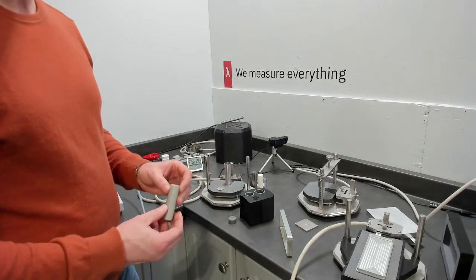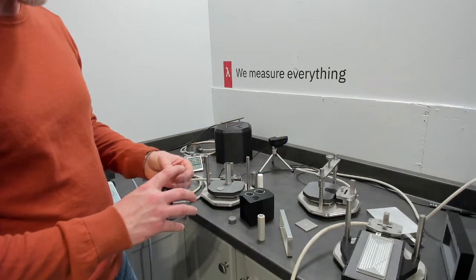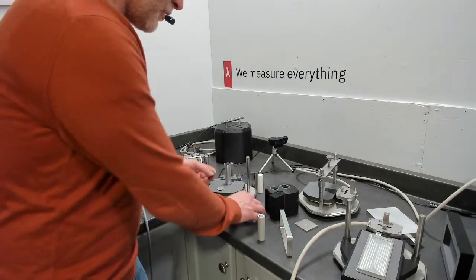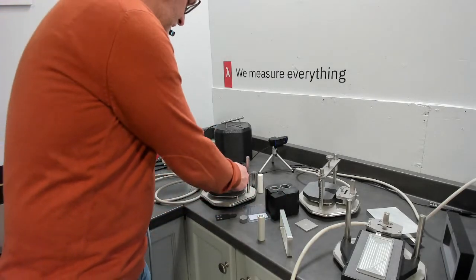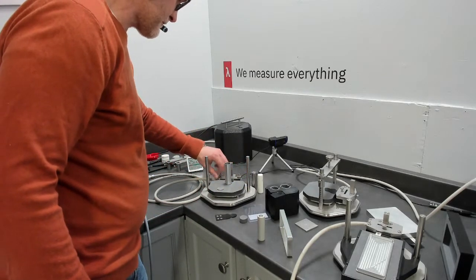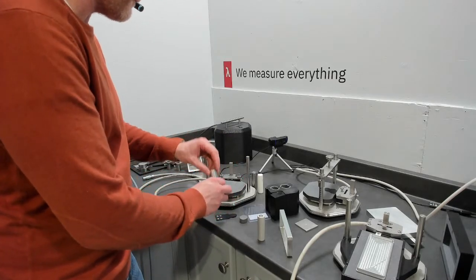Now for running thermal conductivity measurements on a cylinder, we would set up an asymmetric experiment where, if I remove this, let's say we already had the specific heat measurement done.